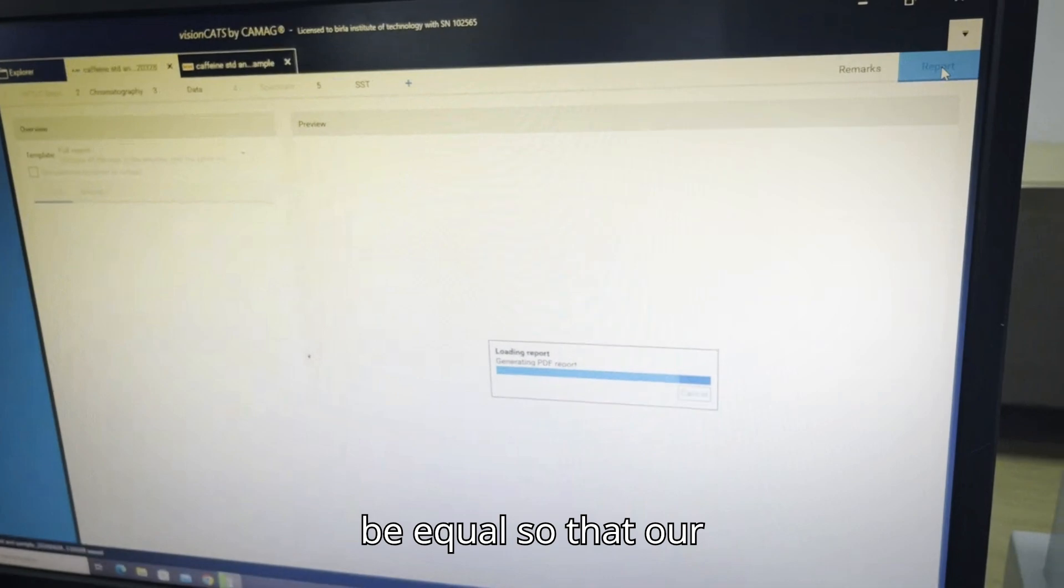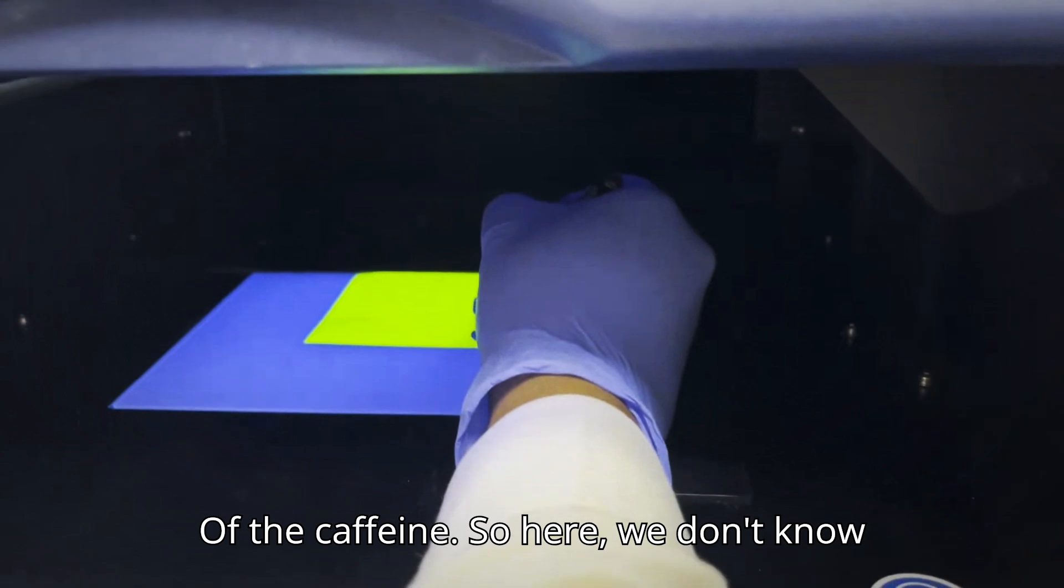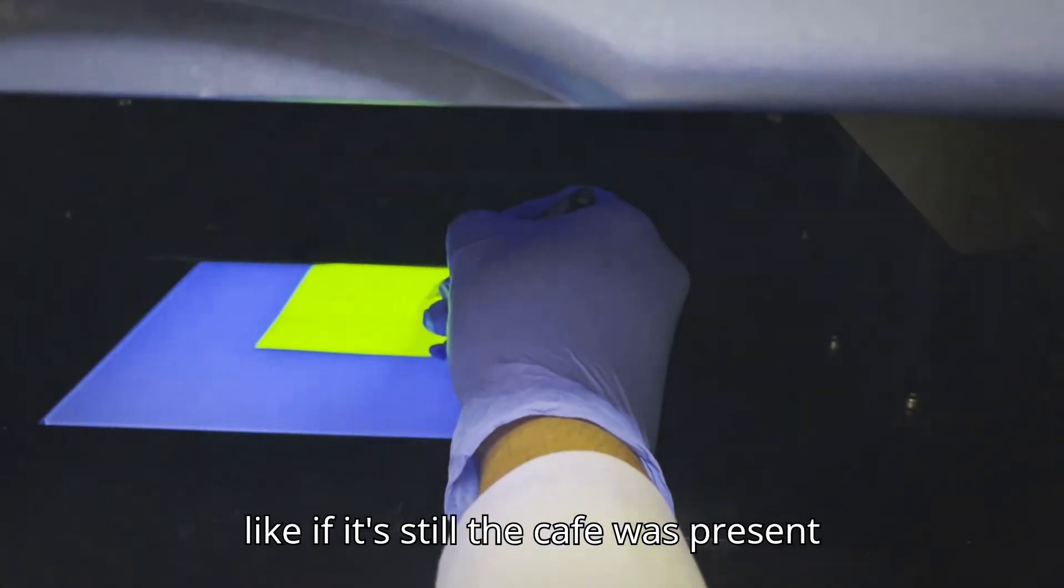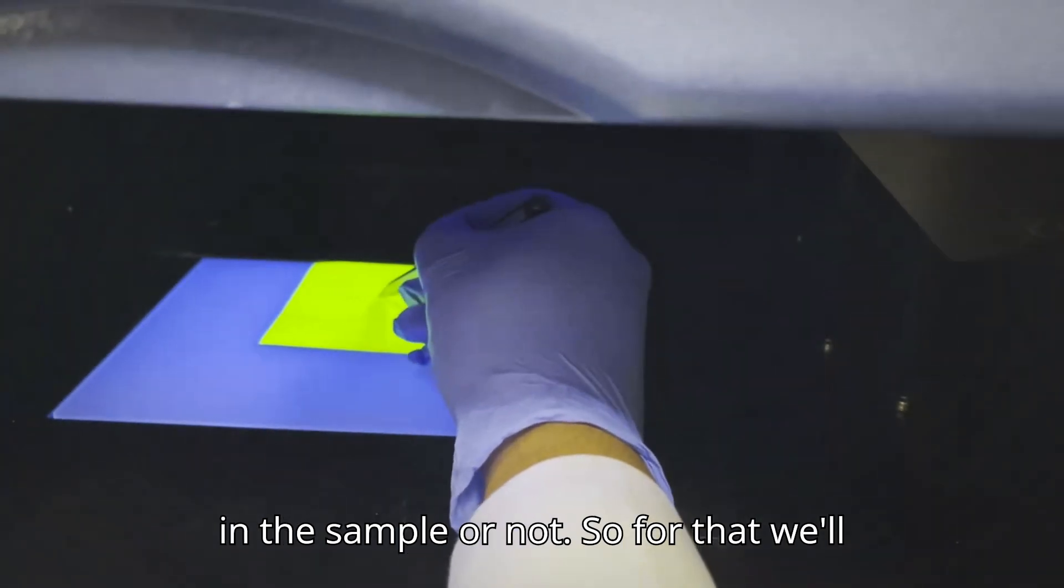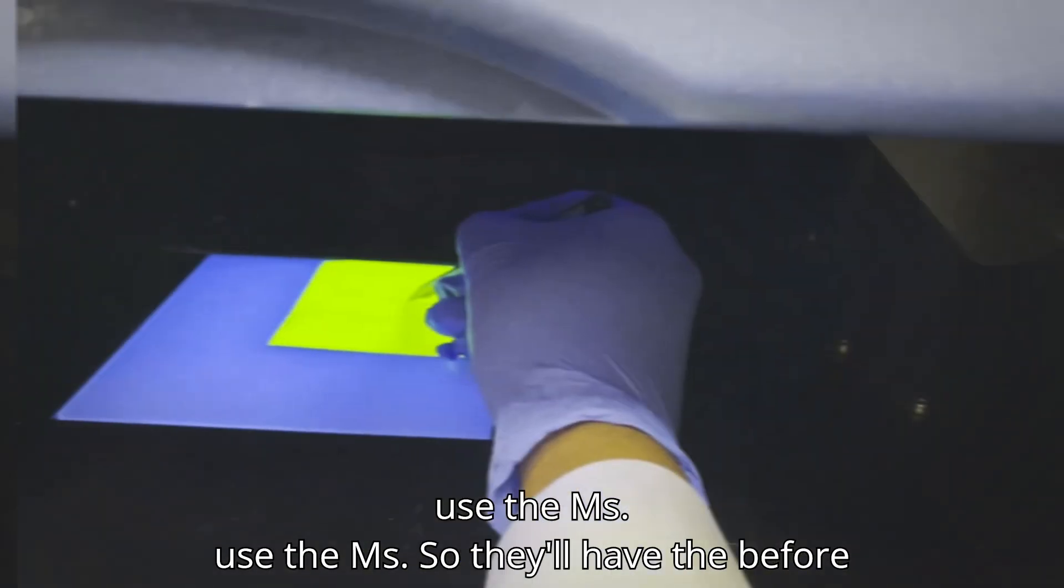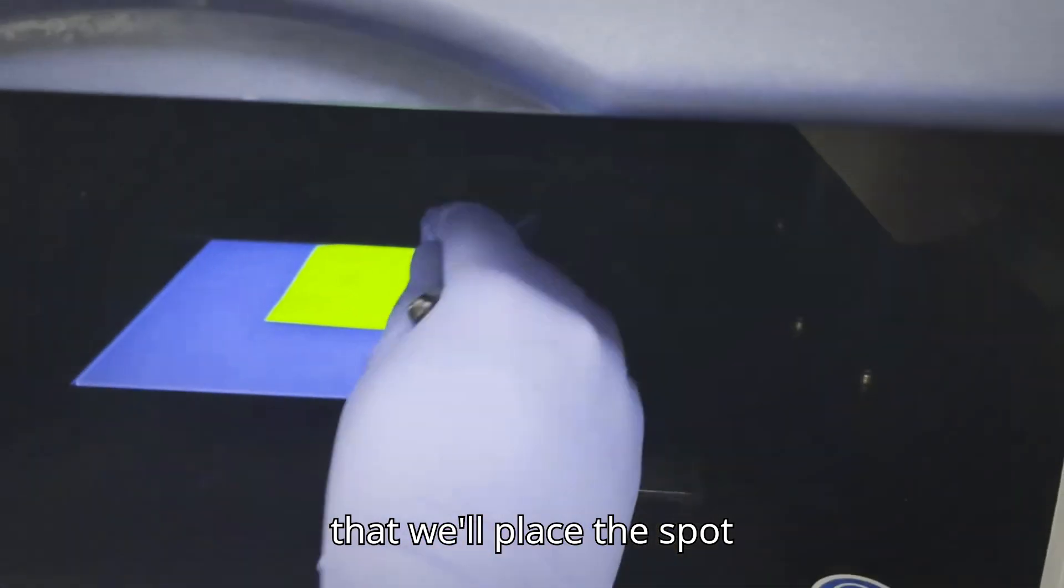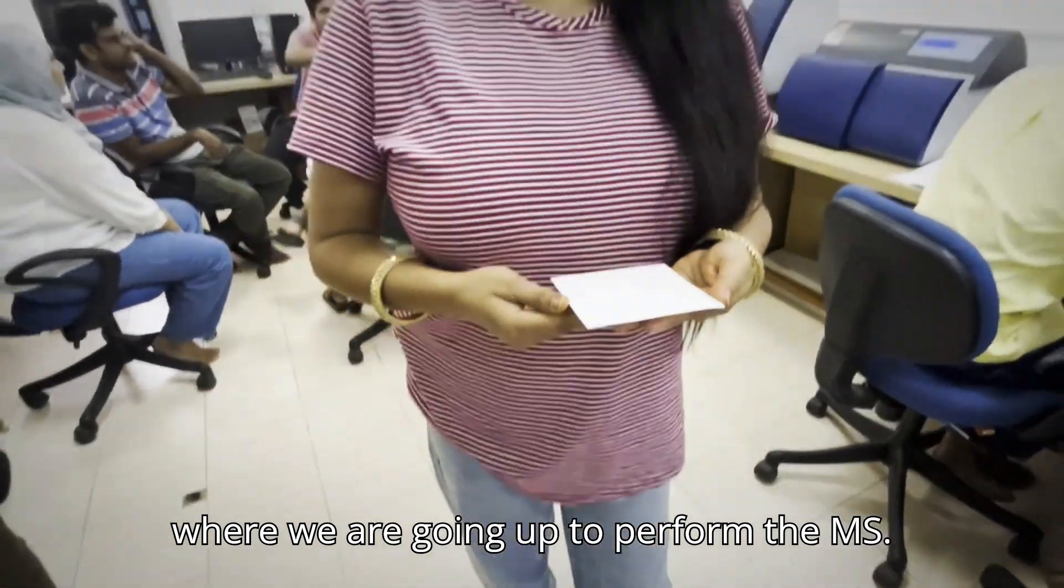Here is the entire data of the caffeine. Here we don't know if the caffeine is present in the sample or not. So for that we will use the MS. Here before that we will place the spot where we are going to perform the MS.